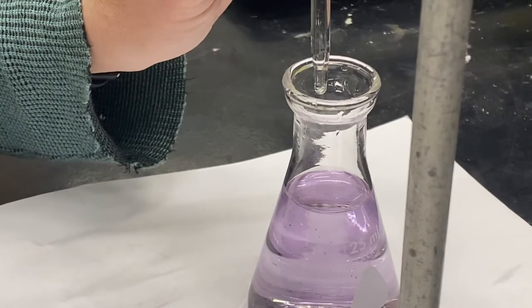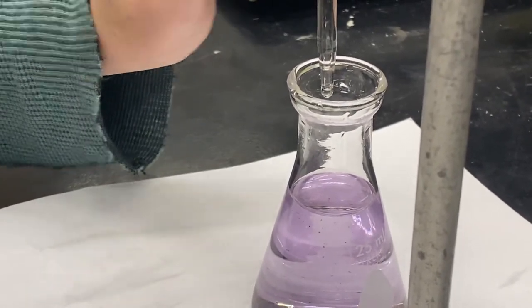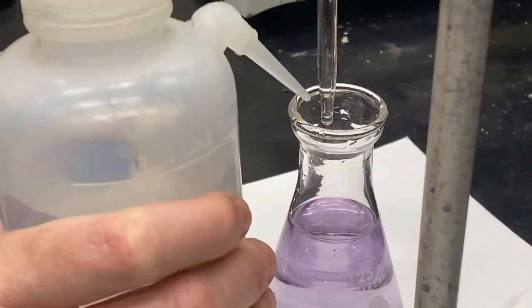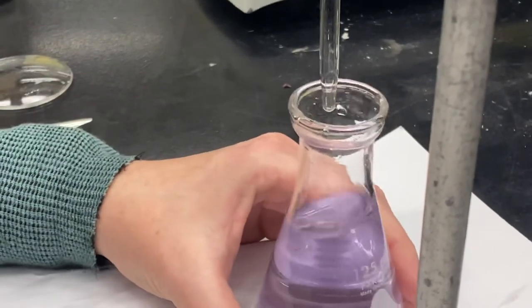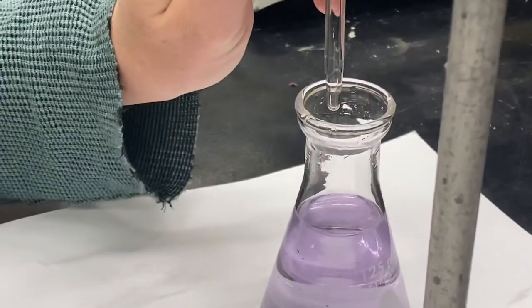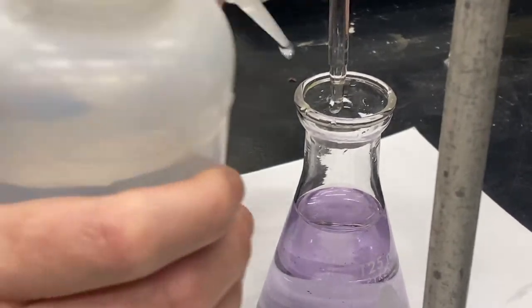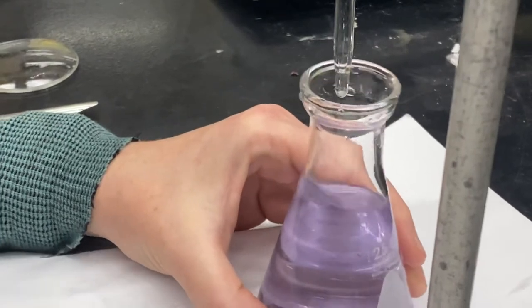So then you can get a clinger by simply kind of pulling it open and stopping. And there, it's probably pretty hard to see, but there's one drop that's just kind of hanging right there. And then you throw it in and twirl it around. And this is kind of a method you want to use for the last few drops of a titration.